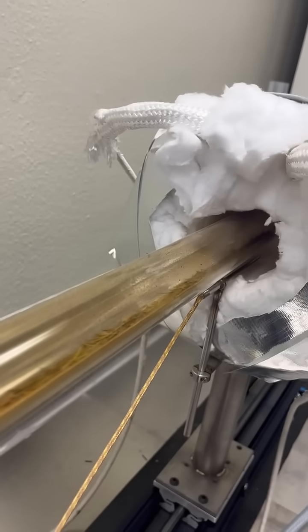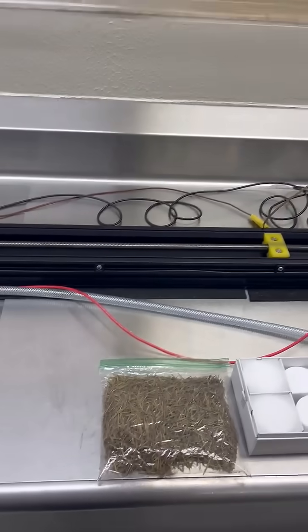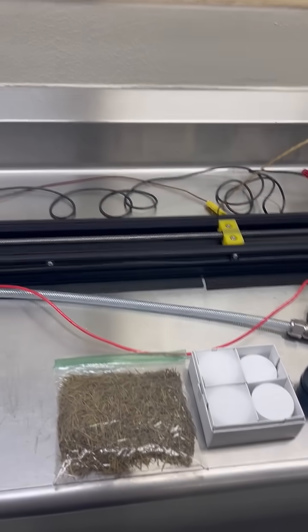Inside the quartz tube is a boat that we load with material and you can see the material goes into the quartz furnace, excuse me, the ring furnace.